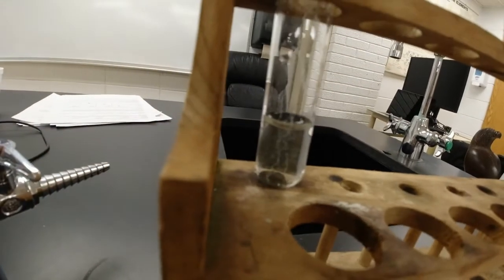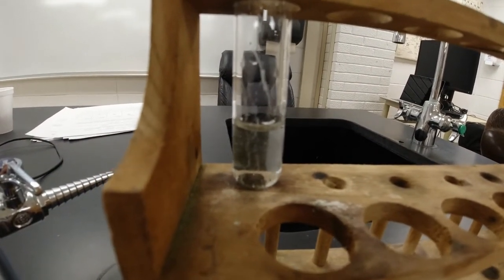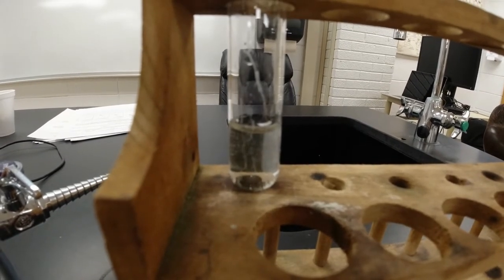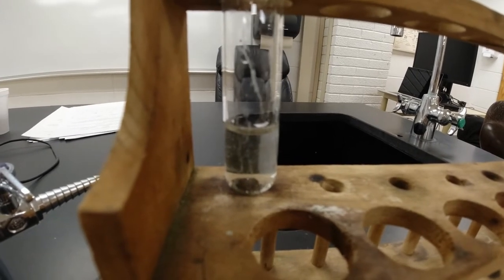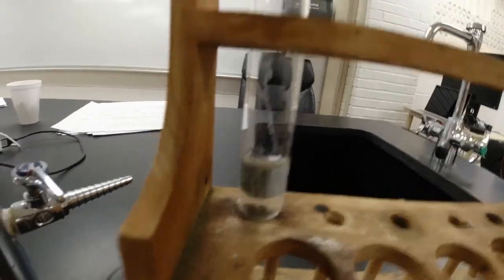That's the copper that was there, and all the copper and the zinc have traded places. So now there is at least maybe a copper-coated chunk of zinc at the bottom of that, but all the blue, all the copper has gone out of solution. It went into the chunk at the bottom. And so you can see that there was a complete change. It took overnight to do it. It was slow, but that's what happened.